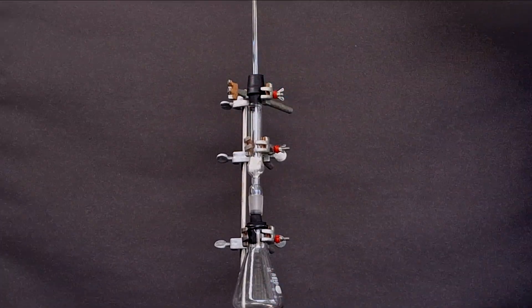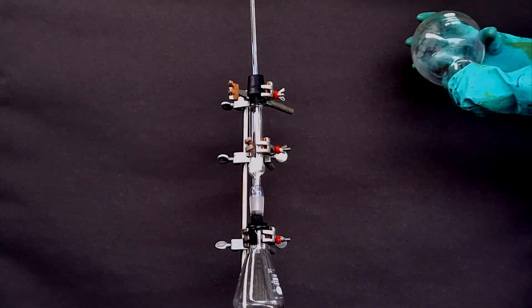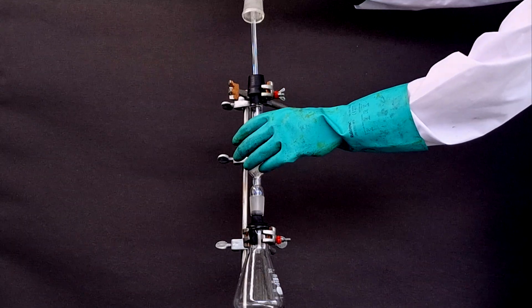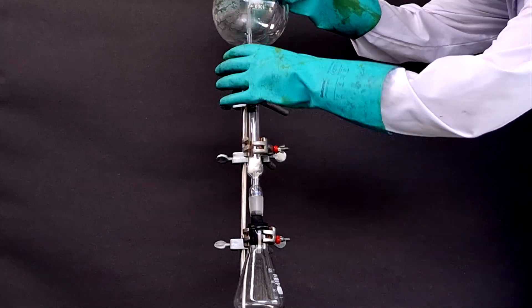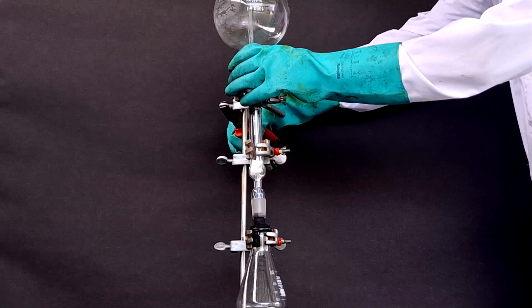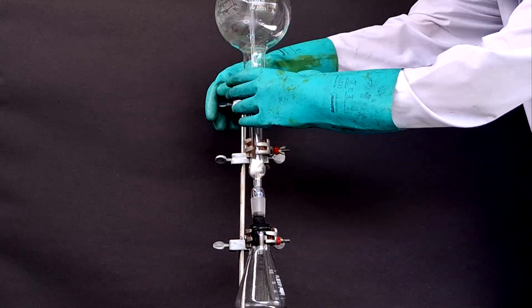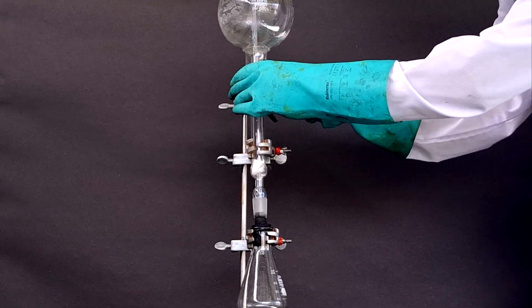And finally, placing the boiling flask right above the drying tube where the fountain will take place. I also added two pieces of indicator paper inside the drying tube and boiling flask respectively.